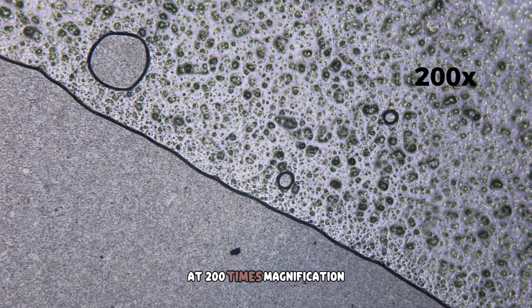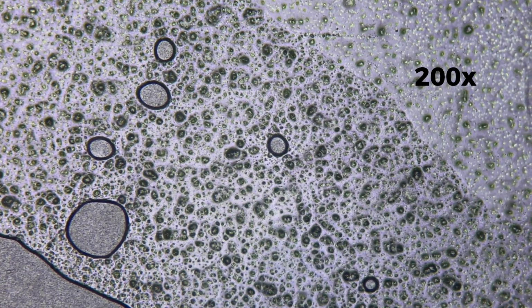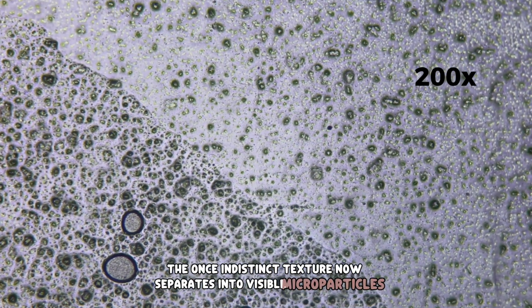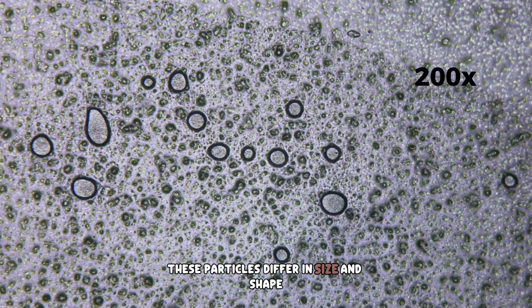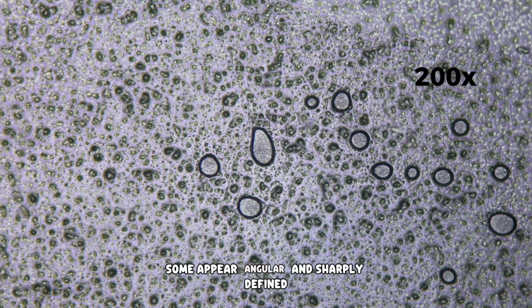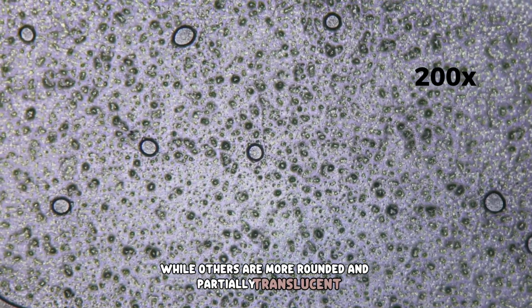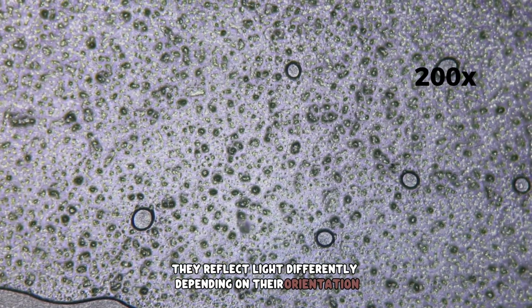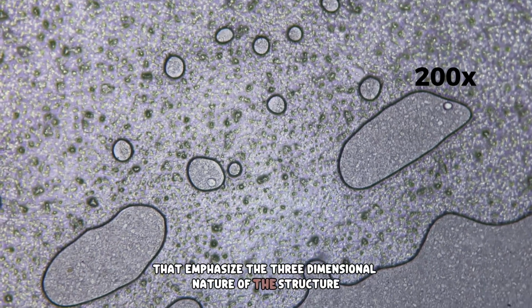At 200 times magnification, the internal complexity becomes much more pronounced. The once indistinct texture now separates into visible microparticles, embedded at varying depths within the gel-like base. These particles differ in size and shape. Some appear angular and sharply defined, while others are more rounded and partially translucent. They reflect light differently depending on their orientation, creating subtle highlights that emphasize the three-dimensional nature of the structure.